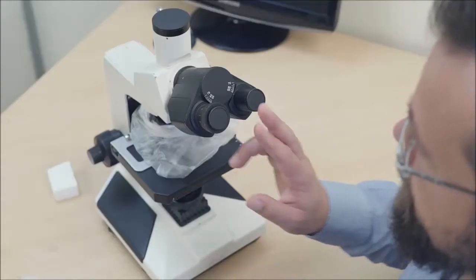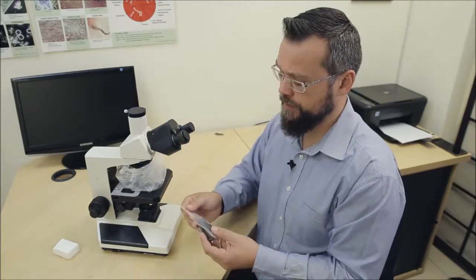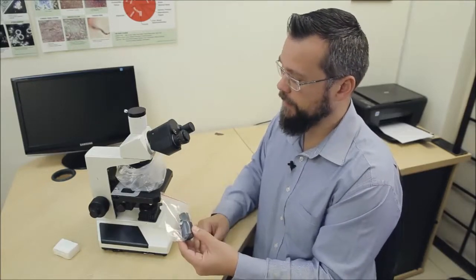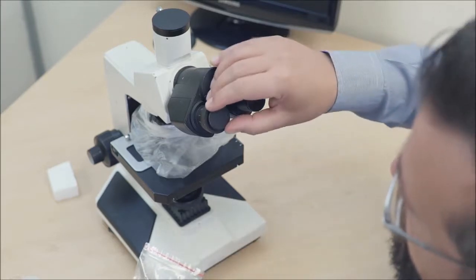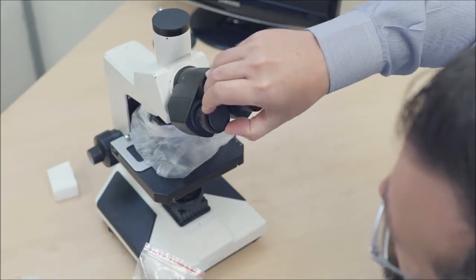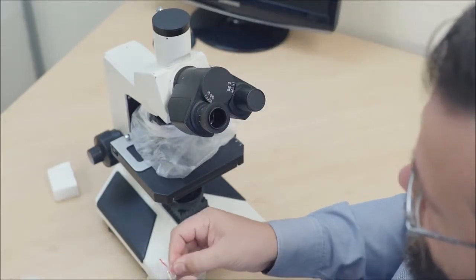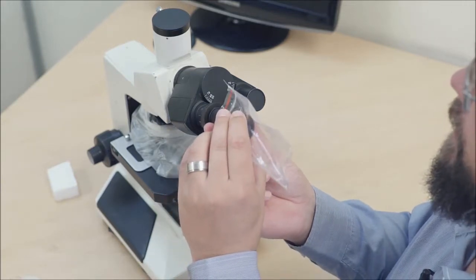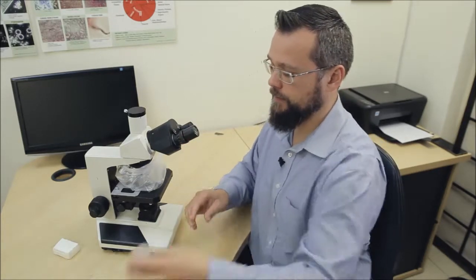The next step is just to insert the eyepieces into the microscope and this is quite simple. They really just slide into place. The main thing is just to be careful to prevent and avoid dust from getting into anything here. That's why they're still sealed in the packaging and there are protective plastic caps on the front of the eyepieces. So we're going to just pull these protective caps out, open the packaging, and slide the eyepiece into place, and the same process with the other one.